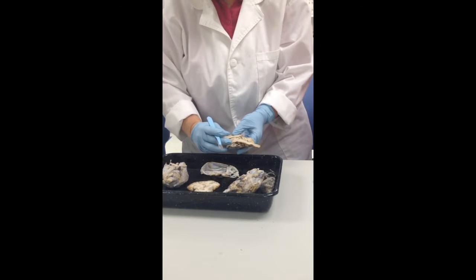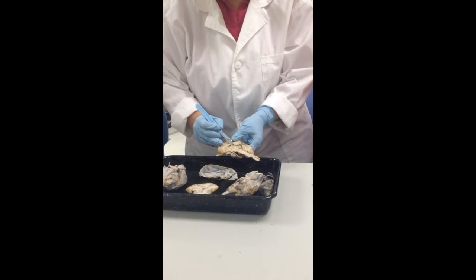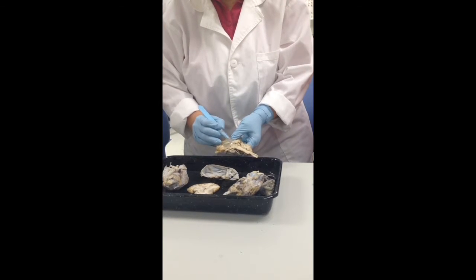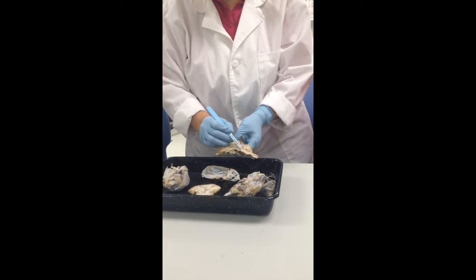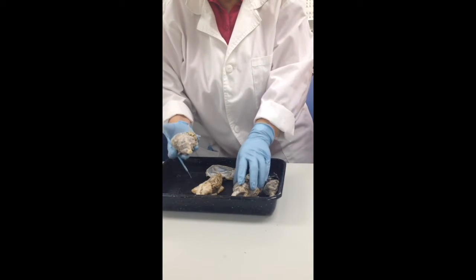And if you look closely there, you can see a little bit of the lateral ventricle and the choroid. And this little fold right here is the fornix. So that means that this right here would be the thalamus. Right below the thalamus is your midbrain, and then the pons, and then medulla oblongata. Okay. So those are your major structures that you can see for this part of the brain.